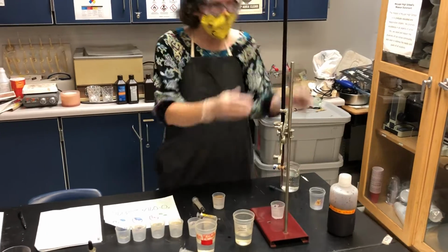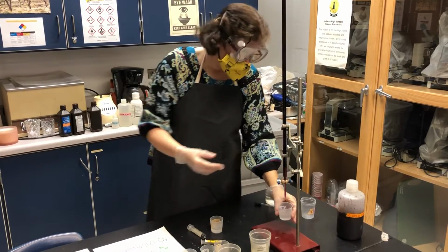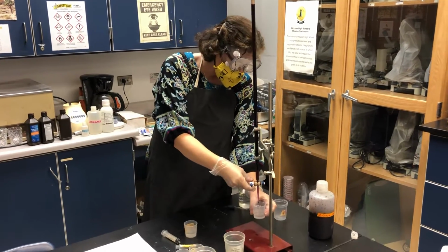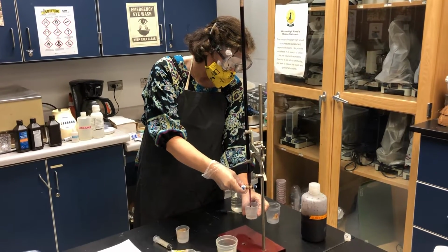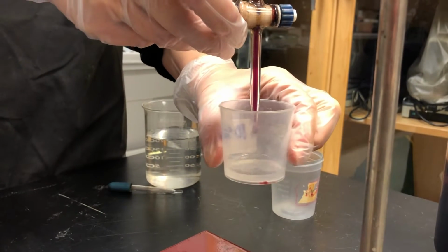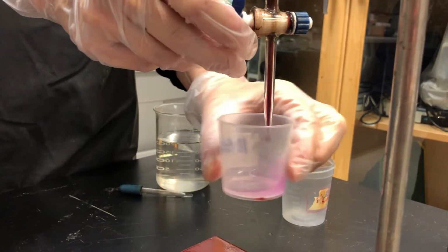Now this is potassium permanganate. It's a very bright purple substance, and I'm going to be titrating this cup by dripping. First of all, I'm starting with 0 mils. I already wrote that down at the top. And I'm going to keep adding purple to this until it stops disappearing. So now we need a real close-up of this, if we can. And titration means we are using a known amount of a reactant to detect an unknown amount of a different reactant.